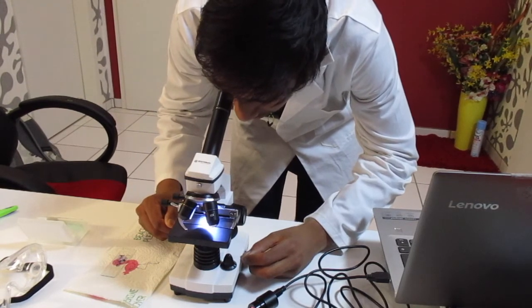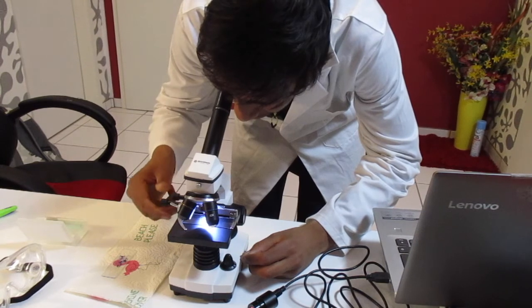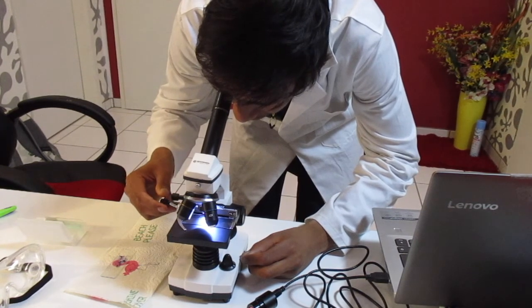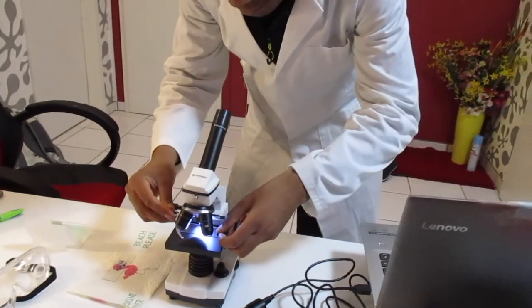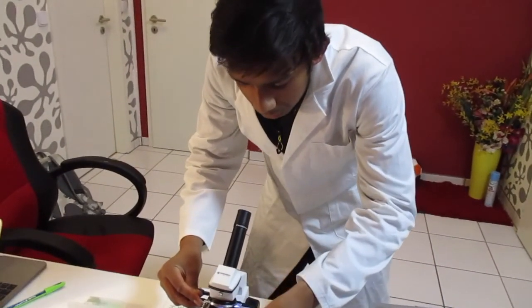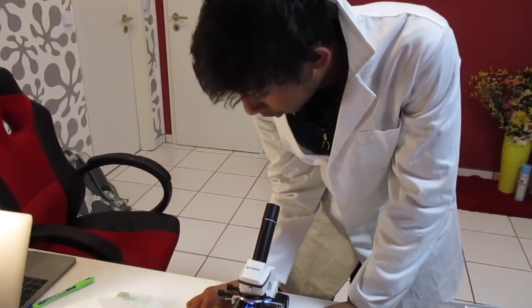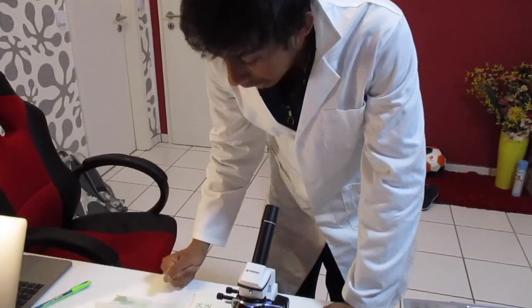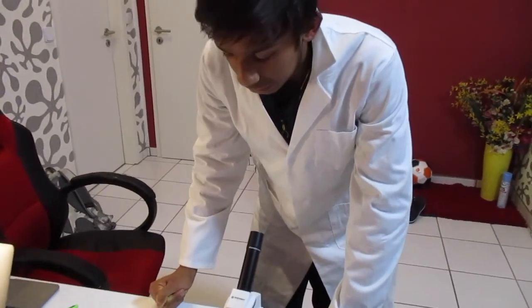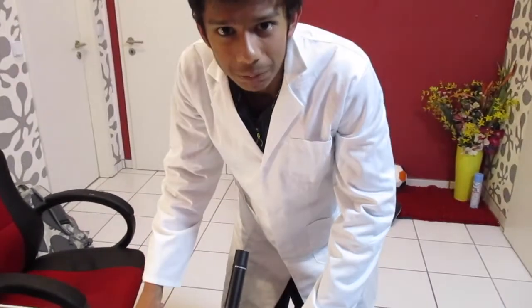Yeah, this is a clear overview. You can see it very nicely. Okay. So now that we've observed the roots grown in distilled water and caffeine, it's time to look at the results and the analysis and reach a conclusion.